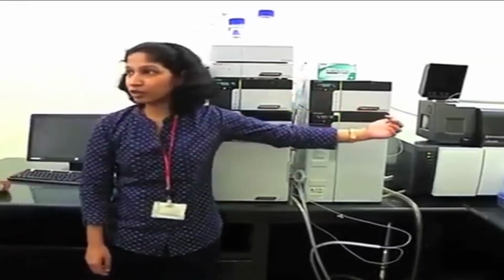That has already been explained, right? Like I explained to you the carryover effect, the same carryover effect can come in your mass spec as well. Suppose I am monitoring one particular transition. That peptide went inside the collision cell, it generated some fragments, and I detected the fragments. But if all the fragments are not getting emptied from that collision cell, and then I start monitoring my second peptide, and some of the fragments are common between these two transitions, then I can get an enhanced signal because of the traces of the previous transition's fragments. That is called crosstalk, right? And I want to avoid the crosstalk.